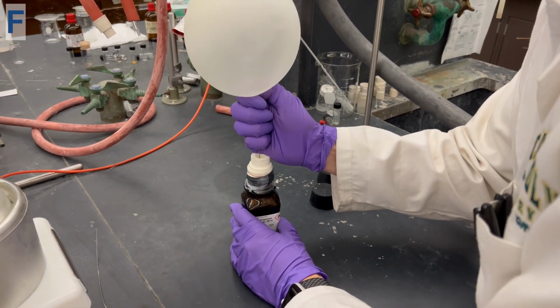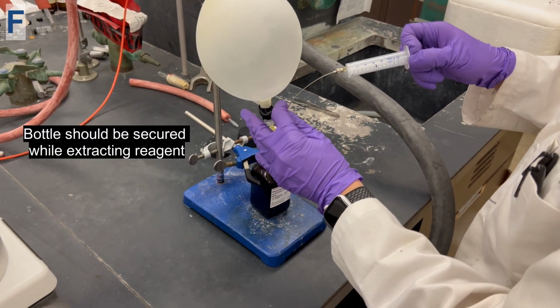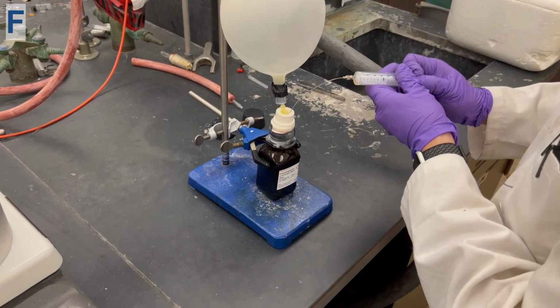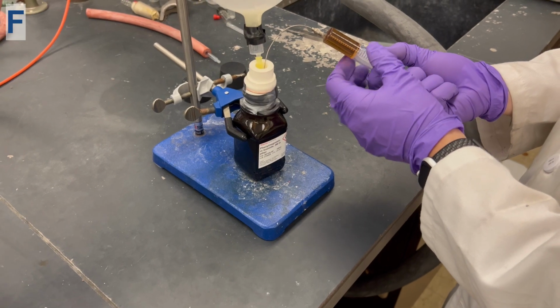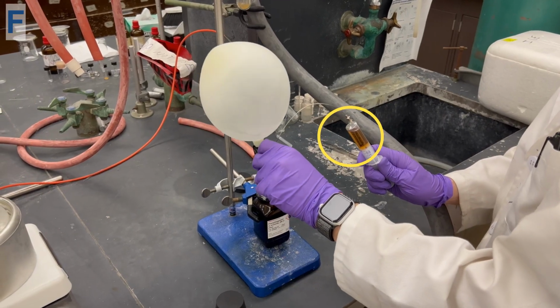First, insert a nitrogen balloon into the septa covering of the Grignard reagent bottle. Next, insert the syringe needle into the top of the septa and begin extracting the appropriate amount of reagent for the experiment. When transferring to the addition funnel, make sure to fill the syringe with some nitrogen gas.